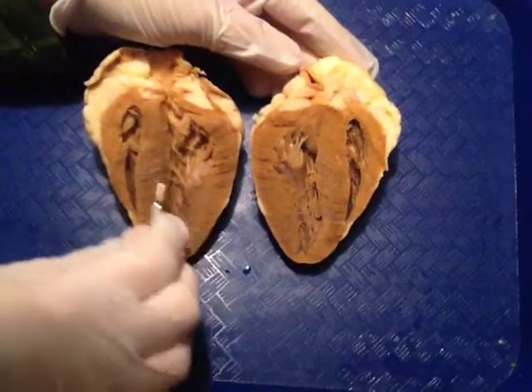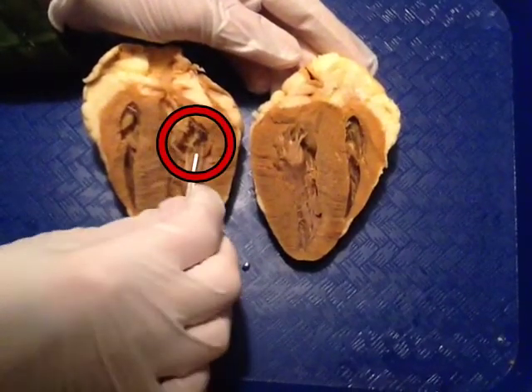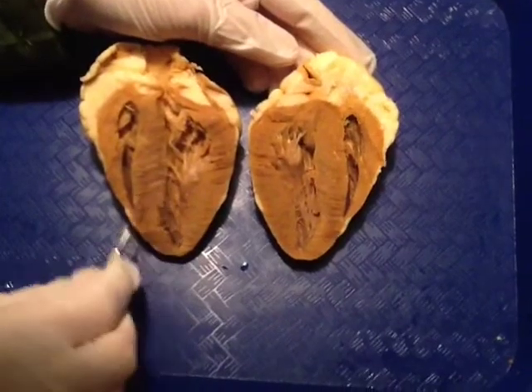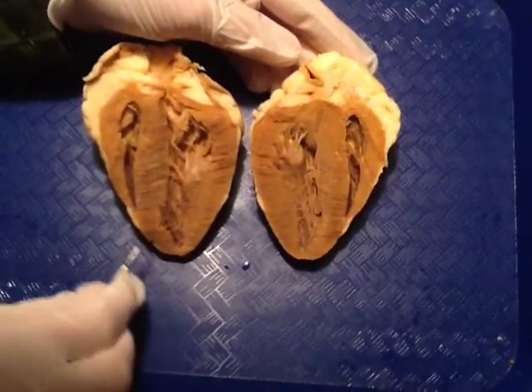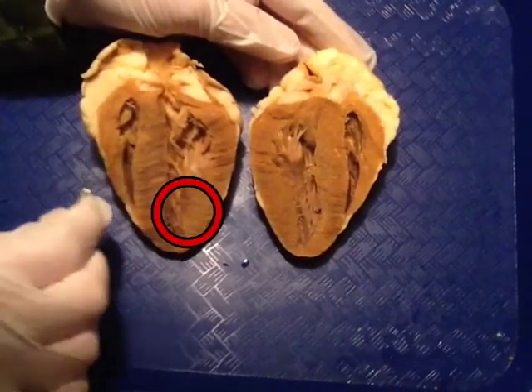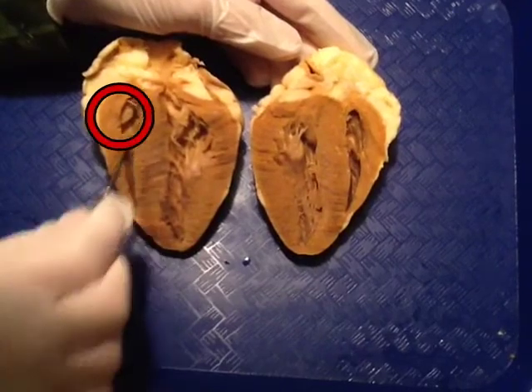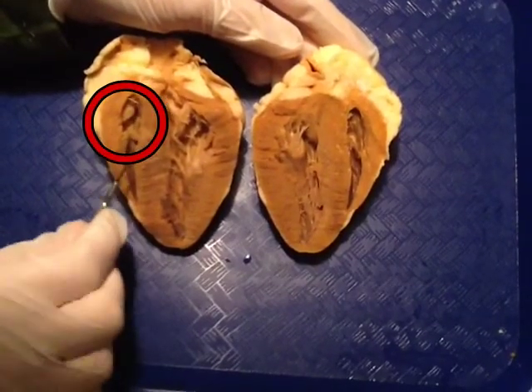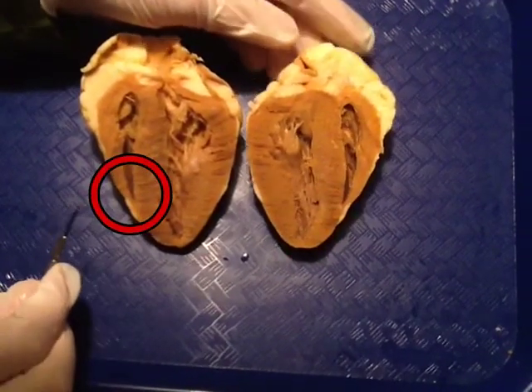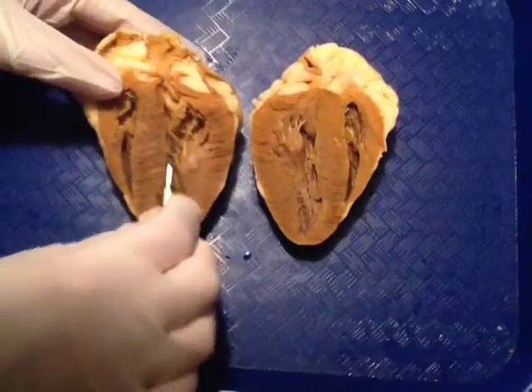Right here you are going to see the left atrium, the left ventricle, the right atrium, and the right ventricle. Let's take a closer look.